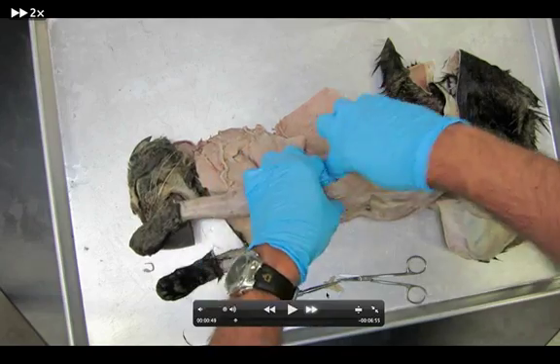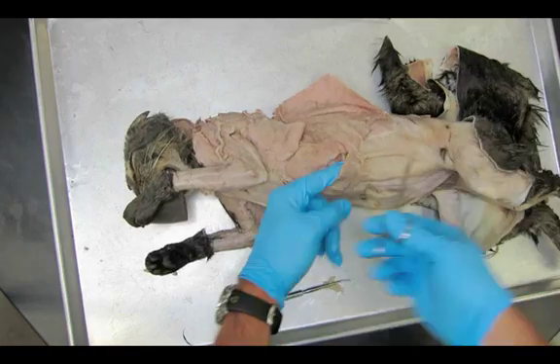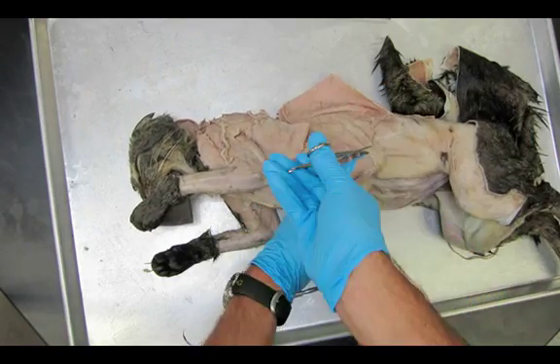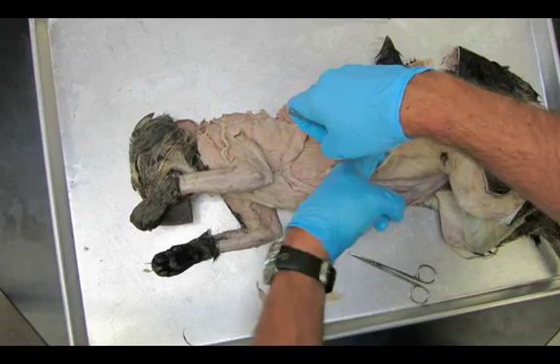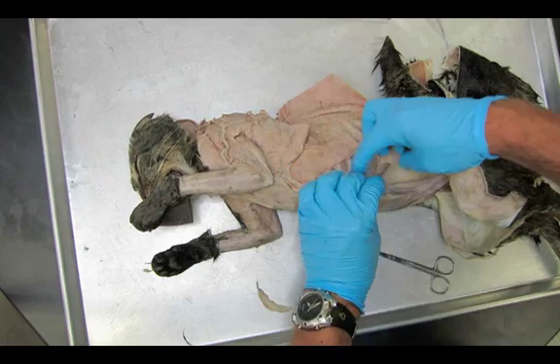You're going to see this nice frown shape cut, or a rainbow. So I'm going to go all the way to the groin. Kind of like what we did when we were pulling the skin off — make sure that it's completely freed up from the underlying internal oblique before you put your scissors to it. So external oblique is being cut away, and we're cutting down towards the internal oblique.